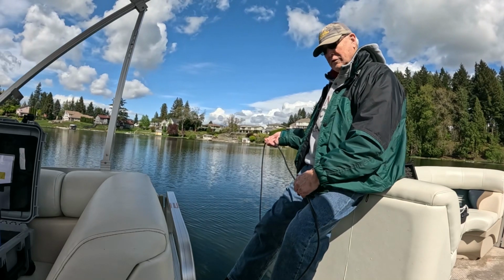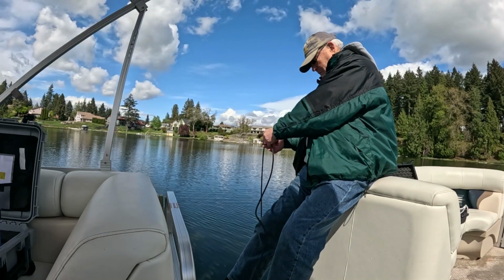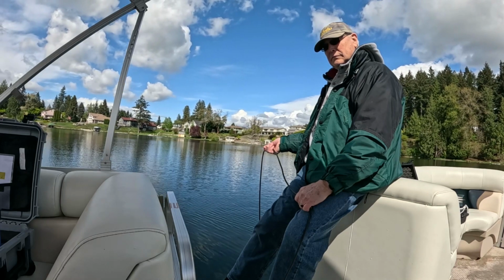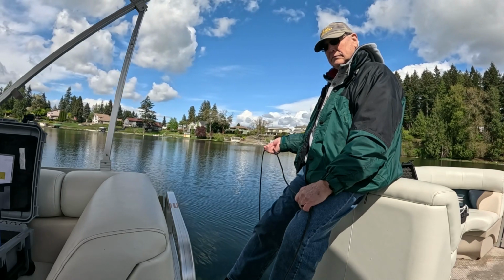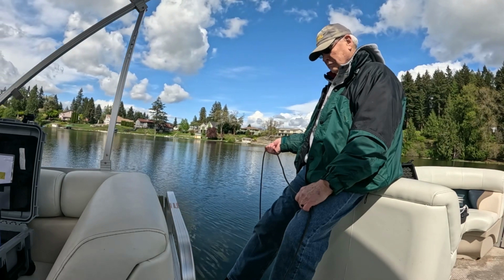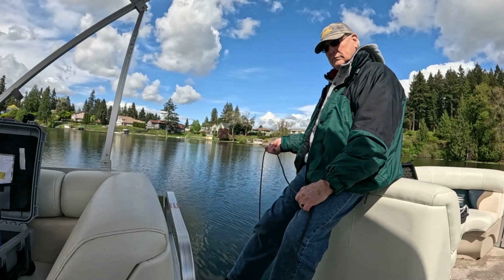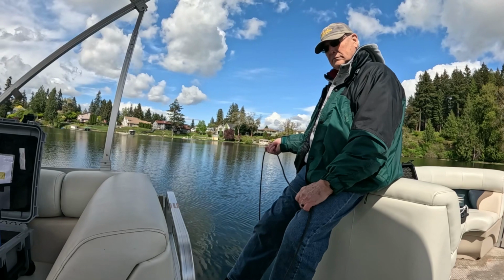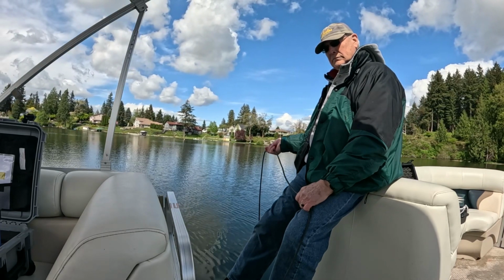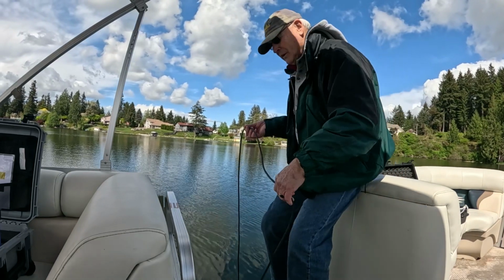You want to go 1/2 meter? 1/2 meter would be as much as I'd go. You're at right there. So 11.3. pH is 6.81. DO really dropped. 2.30. 139.9. And turbidity is 1.14. That's it. Okay, turn her off. Can you hand me that?